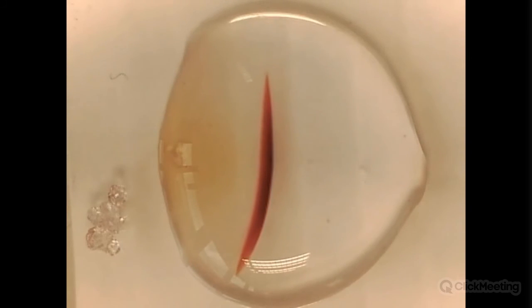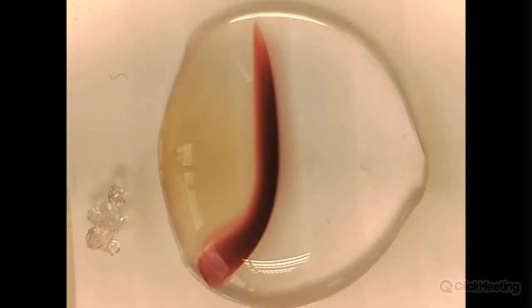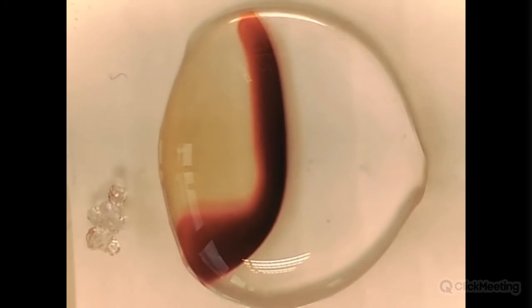Now, interestingly enough, underneath this puddle, there is a neodymium magnet. And see what happens now. The precipitate is deformed. And the magnet has an effect on the ions.